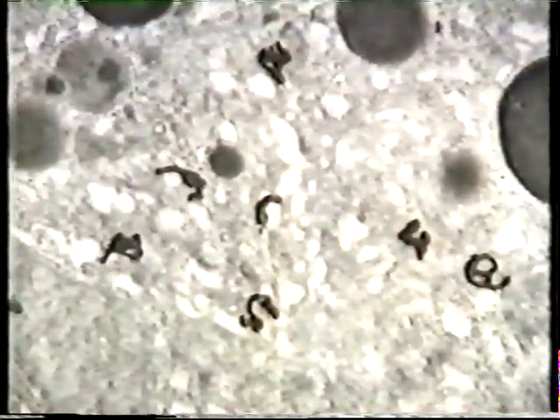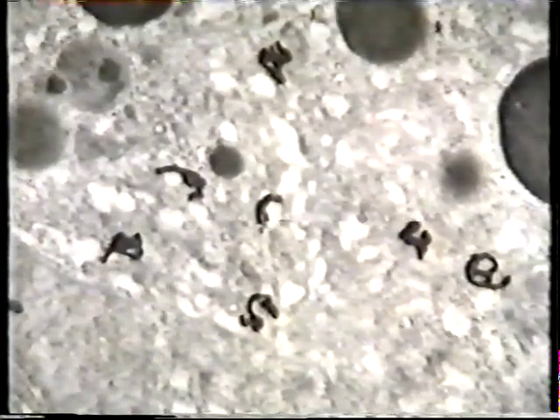The preparations with the autoradiographic grains on them are examined in the electron microscope. And what we see here is the situation found at the end of the pulse. The autoradiographic grains are over the endoplasmic reticulum. After 10 minutes of chase, the grains move from the endoplasmic reticulum to the periphery of the Golgi complex. After 40 minutes of chase, they are on the other side of the Golgi complex over condensing vacuoles.